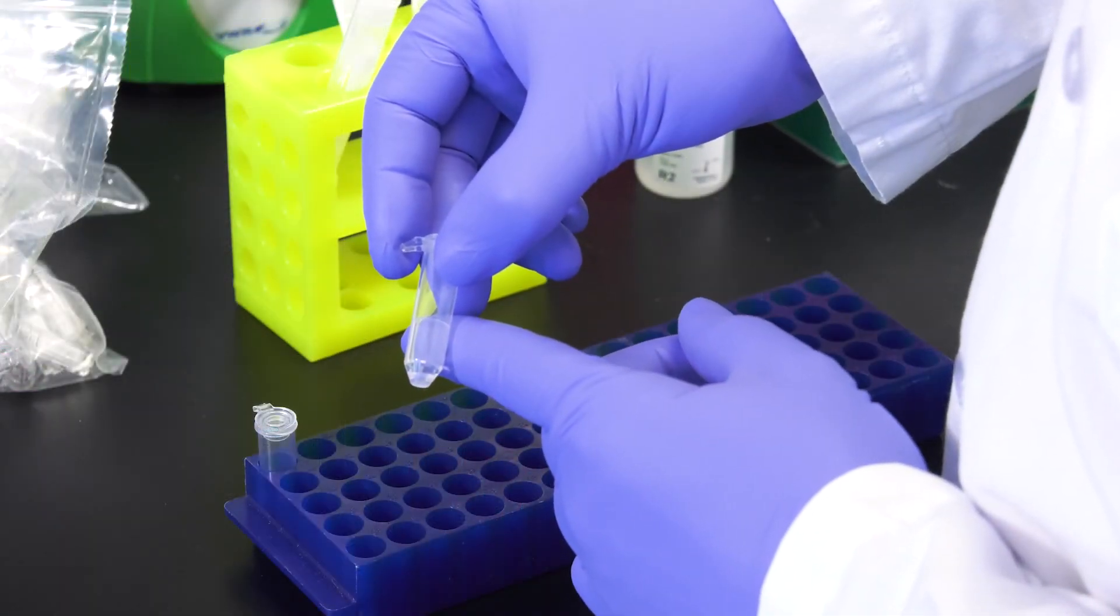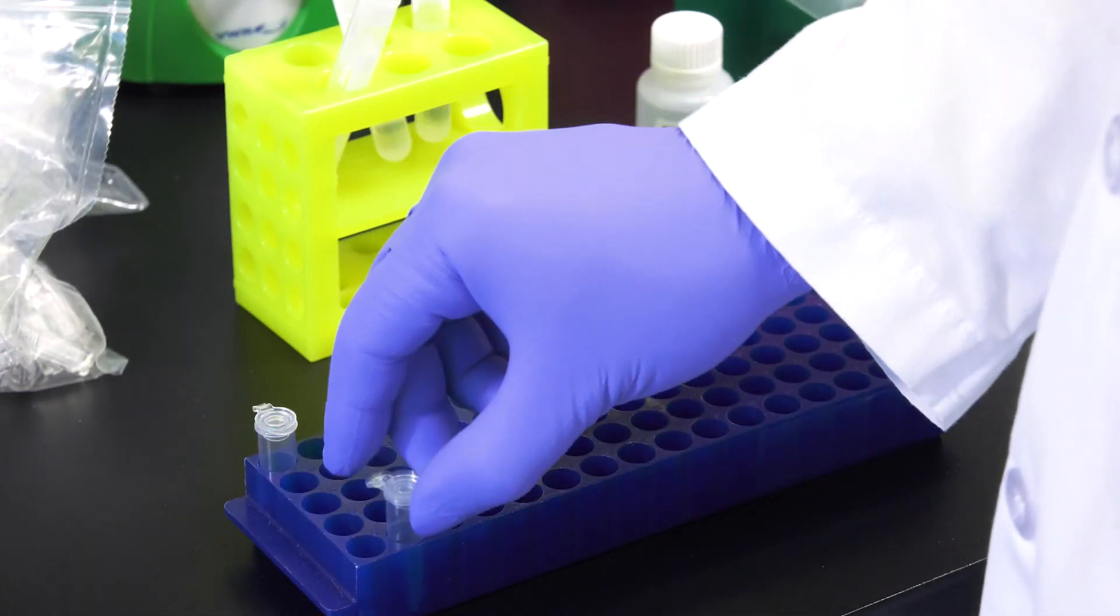You now have 100 microliters of extracted purified DNA. The extracted DNA can be stored at minus 20 degrees Celsius for several months.